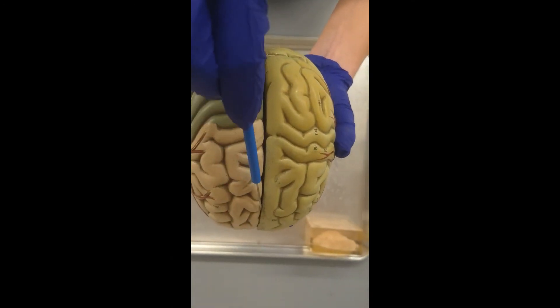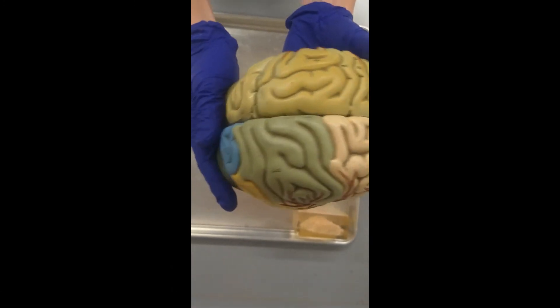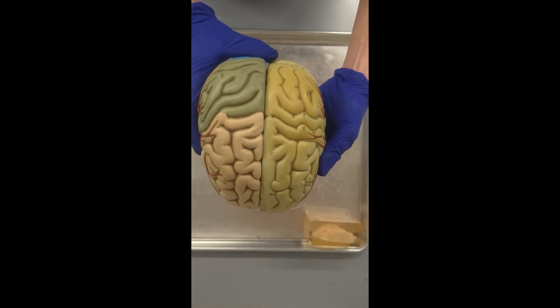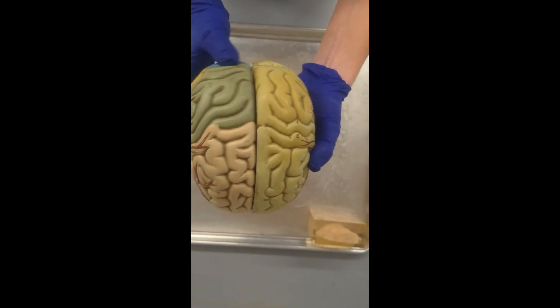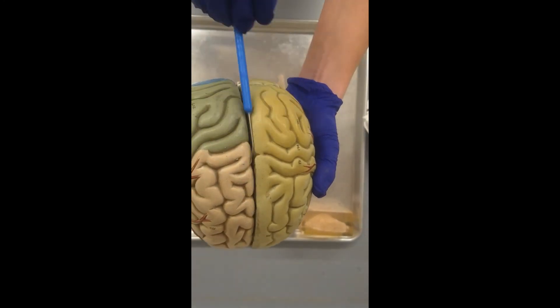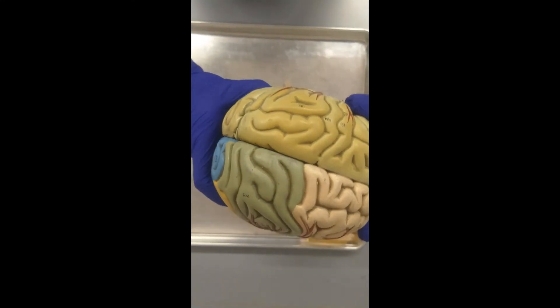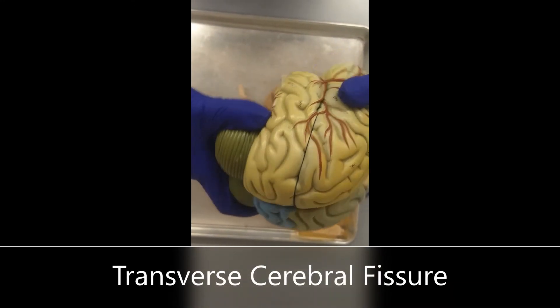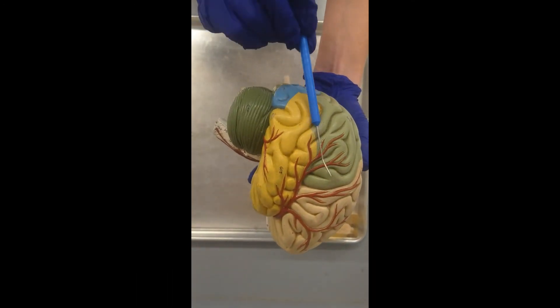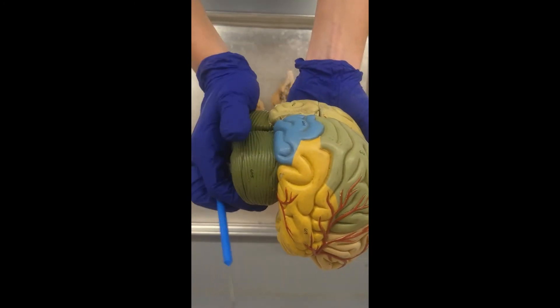The first fissure is the longitudinal fissure. This is the front part of our brain — here's anterior and posterior. The longitudinal fissure is what we're going to be cutting along today, running from anterior to posterior. We also have the transverse cerebral fissure, which is going to be separating the cerebrum from the cerebellum, going all the way around.